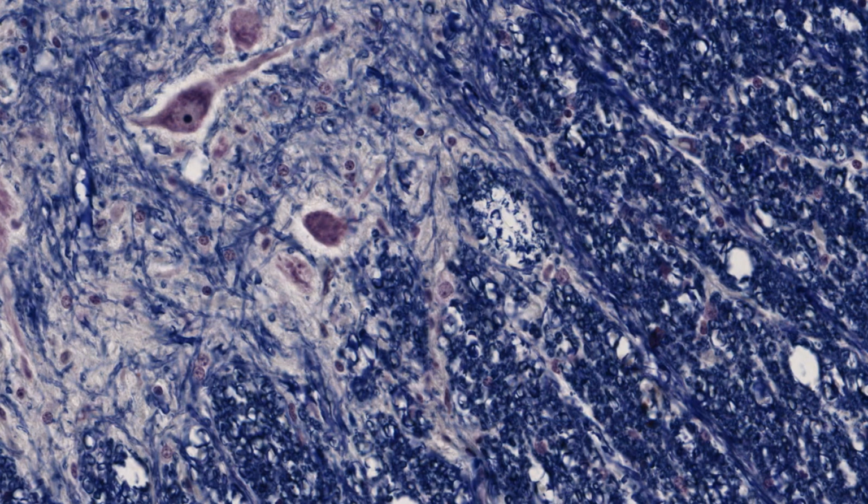This is another section through the spinal cord. It's stained to show up the myelin. Myelin is insulating, fatty material that goes around neurons. It's very similar to the very fine piece of plastic you have wrapped around your copper wires. The myelin sheath insulates a nerve fibre just as the plastic lining insulates the copper wire thread.